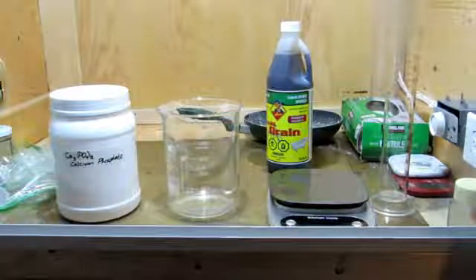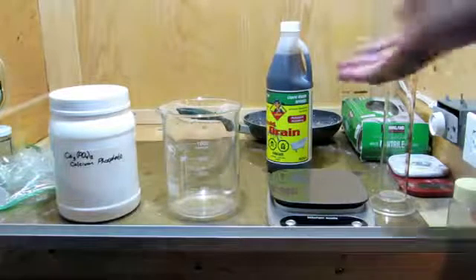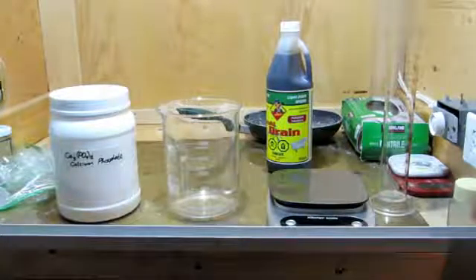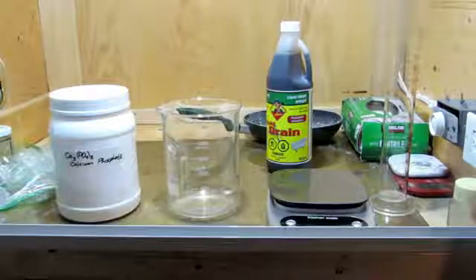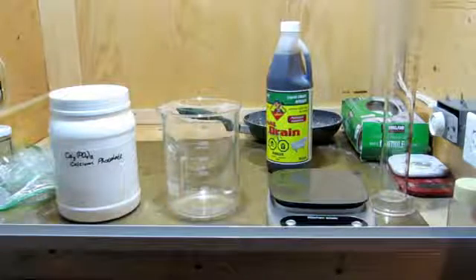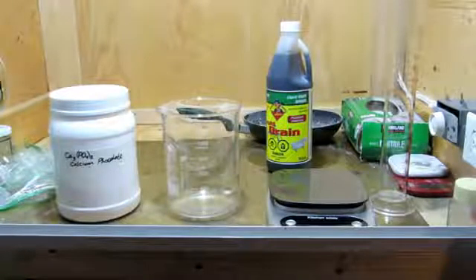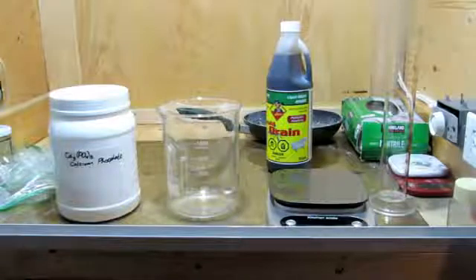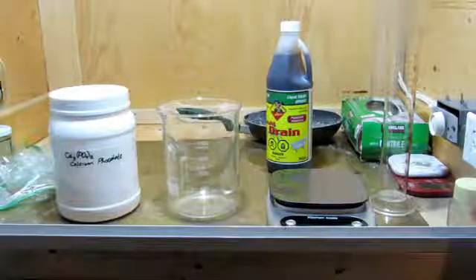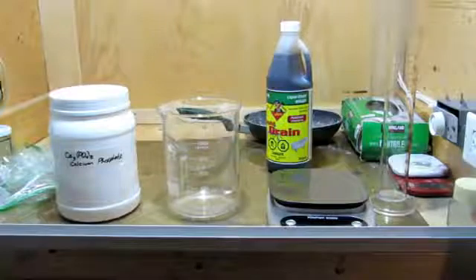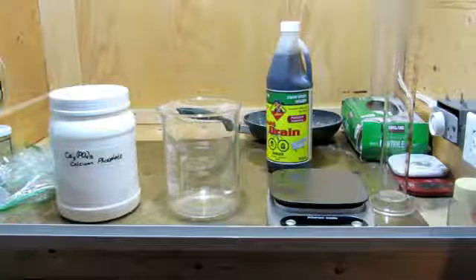Anyhow, the sulfuric acid could be distilled and purified, but for this reaction, we should be able to use undistilled sulfuric acid, and it should be sufficient. The drain opener I have here happens to be very clear, but even more brownish or greenish colored drain openers should be okay, and they're approximately around 93% sulfuric acid on average.